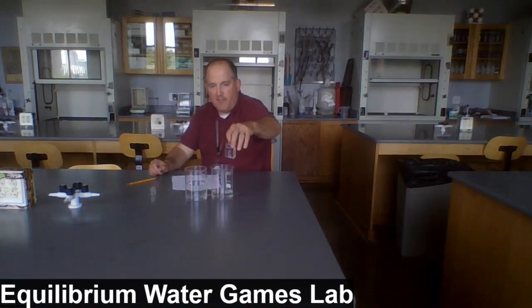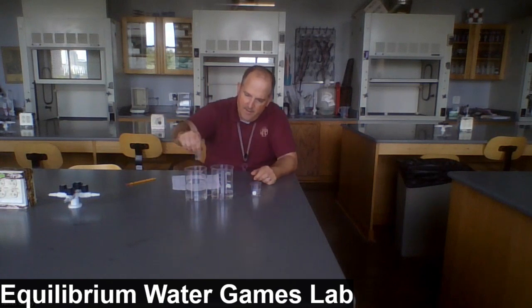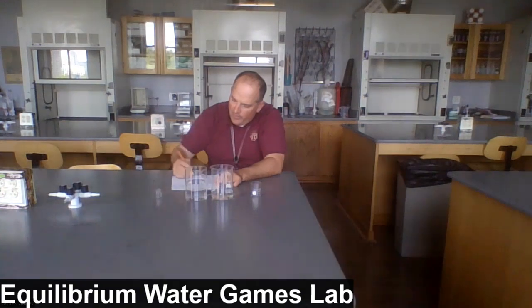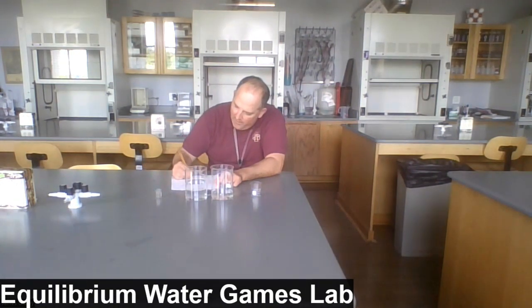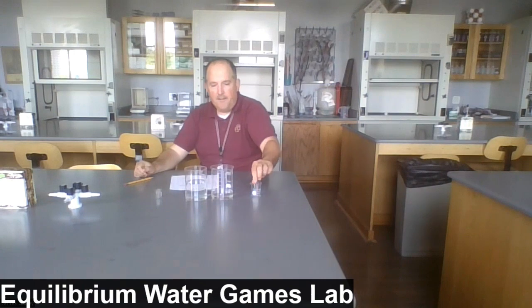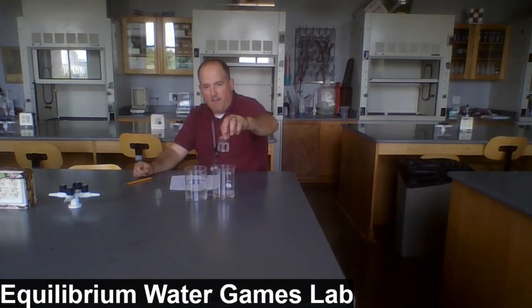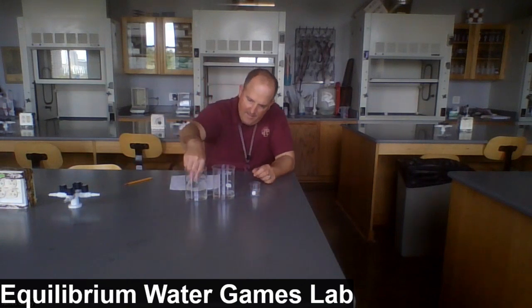And now I'm definitely not filling the bigger of the transfer beakers, but still doing the best we can. After cycle 9, we're at 140 for beaker A and 380 for beaker B. And now I'm getting even less in the larger beaker.